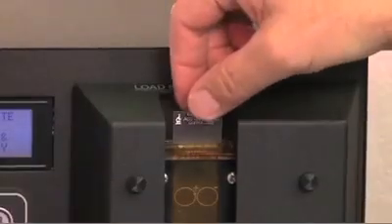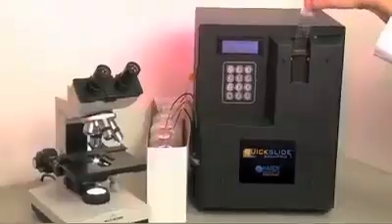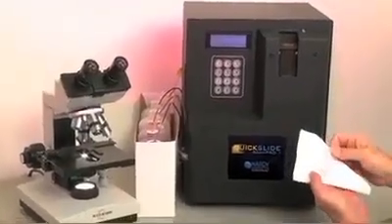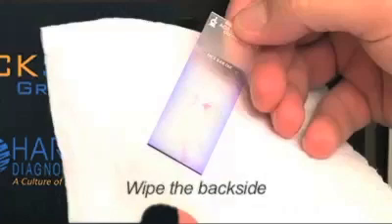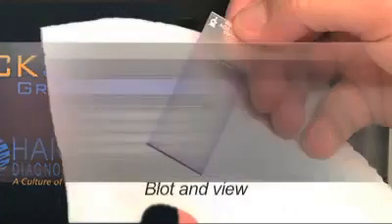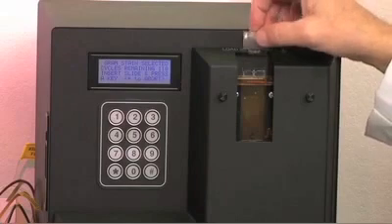When staining is complete, an adjustable audible sound will tell you to return to the stainer to remove the slide. Simply remove the slide, wipe the backside, blot, and view. The Gram Pro 1 is now ready to process another slide.